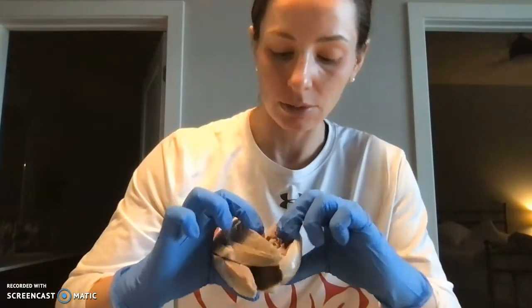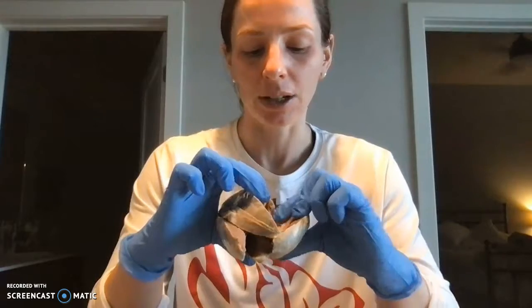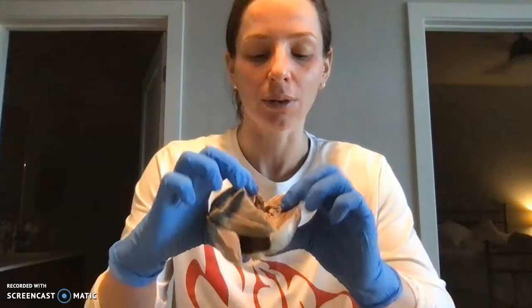I thought this was super interesting opening this up. I think I've done a heart dissection in high school, but it was really cool to see all of this right away when I opened it.